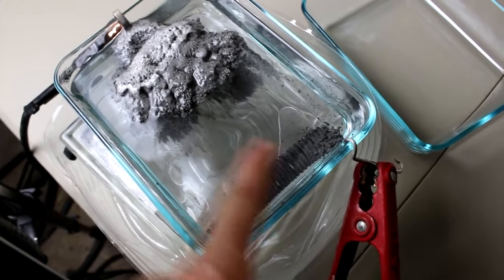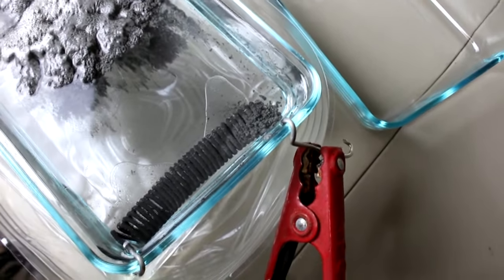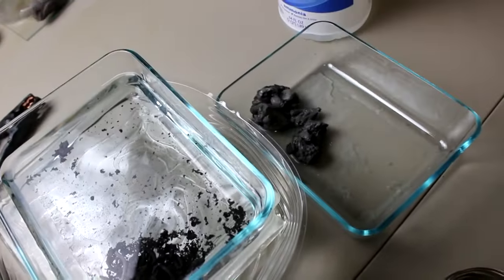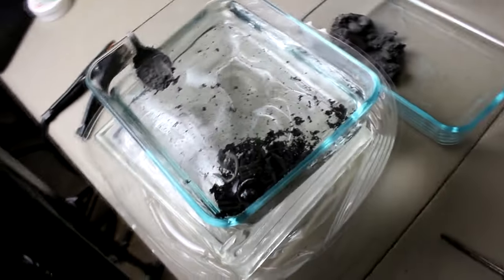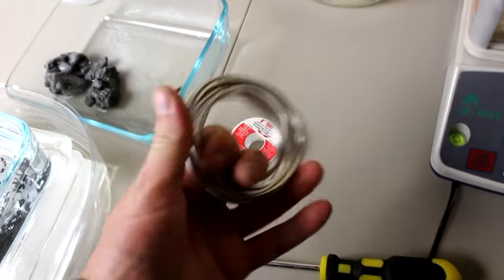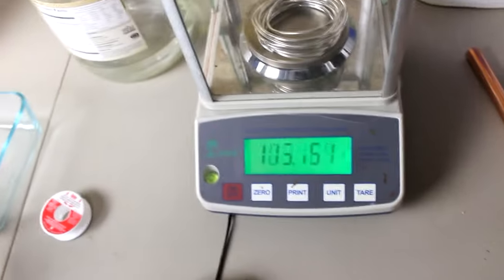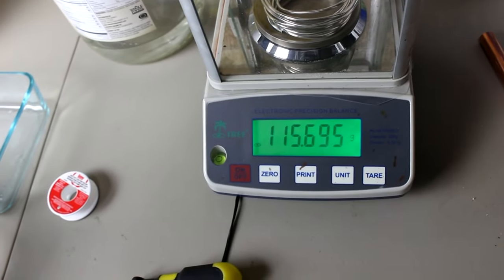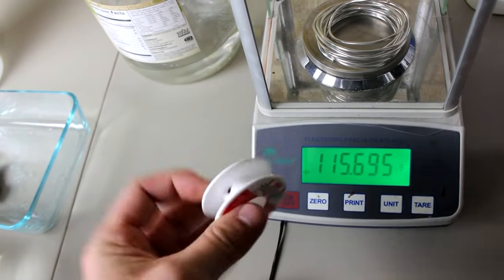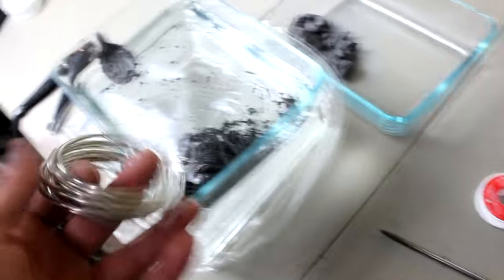Unfortunately, those are very likely to short things out. That's what I got so far. I didn't get to it in time. Must have shorted out. Fortunately, it acts as its own fuse. So, it wasn't really that big of a deal. So, this has been working rather well. You can see this coil is crumbled into pieces and I've processed quite a bit of the tin over. In fact, this has only taken about an hour and a half to do that. There's a lot of tin left here but easily three quarters of it has been transferred. So, I've actually just unrolled this spool of wire here and I'm going to do another one of these. So, we can do a whole half a pound of tin. So, another 115.69 grams. So, apparently there is some variation on the weights of these spools. Anyway, I'm going to set this up. I'm going to process another one.